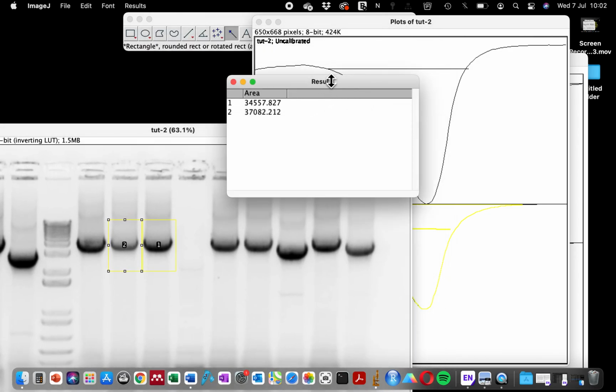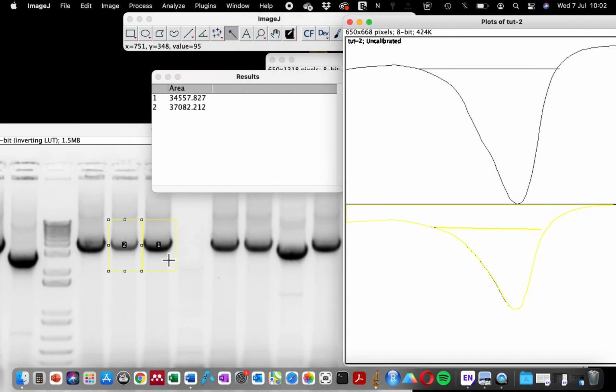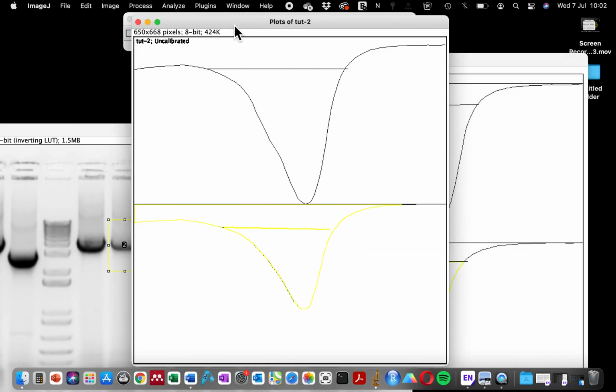And that's why if you look at this quantification, it's really obvious. You can see that the first peak, which is even stronger in size, has a lower quantification value compared to the one with the lower signal. See, the value for this exceeds the first one. And why is that? It's because it has not quantified the peak, but rather quantified the whole rectangle.